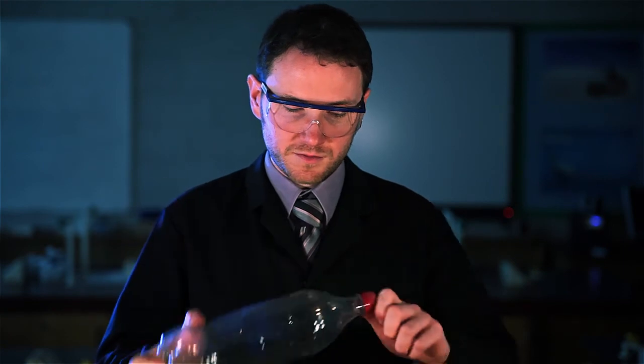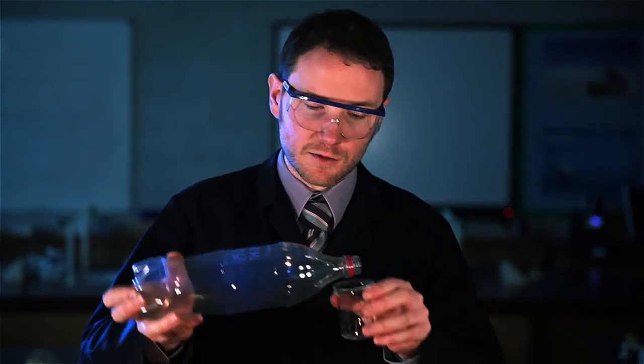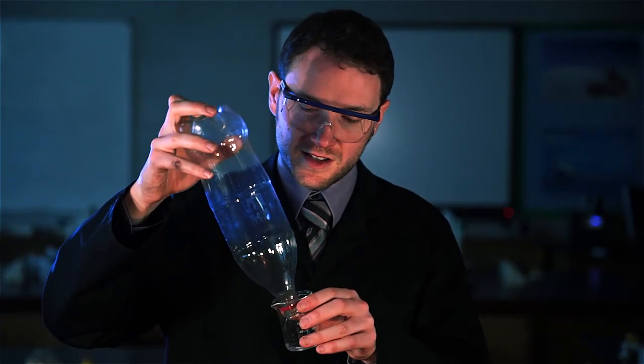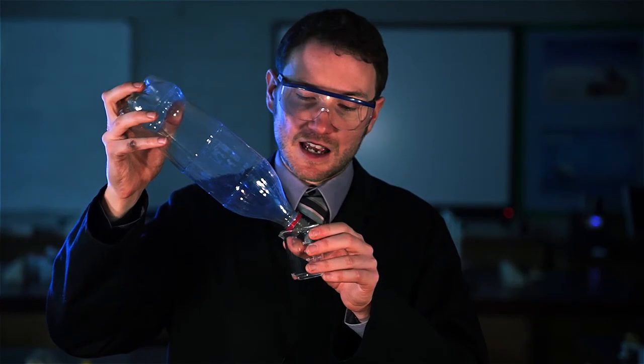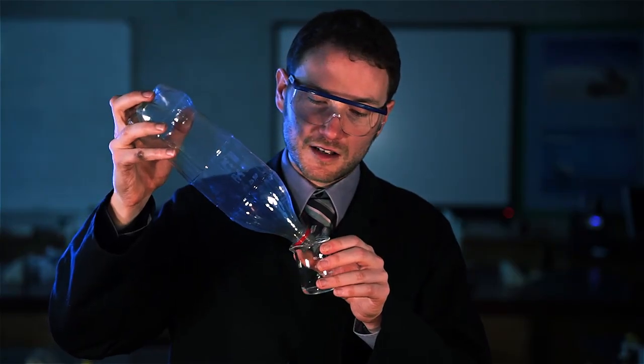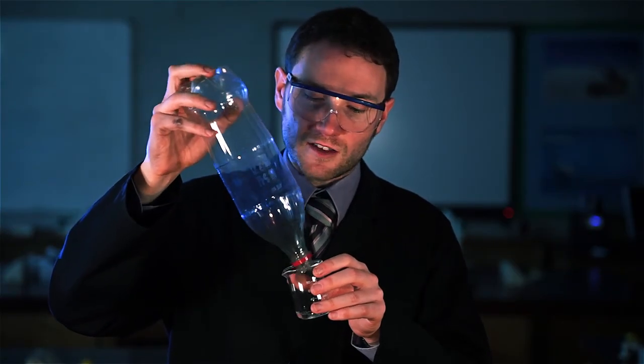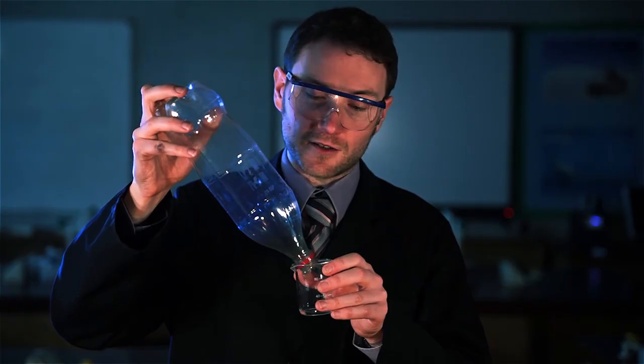Once you've given that a good shake, lid back off and pour out all of the excess liquid. So you want to be drawing your class's attention to the fact that there is no liquid actually remaining inside there, it's only the ethanol vapors that we're interested in, and of course the oxygen.